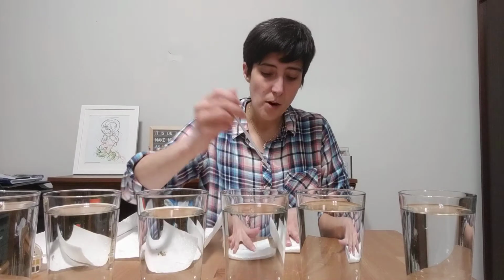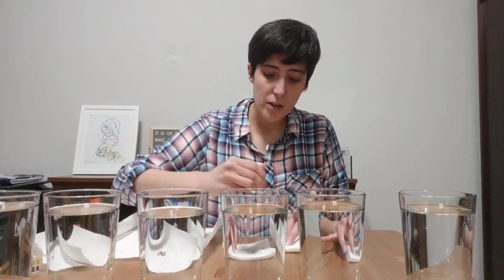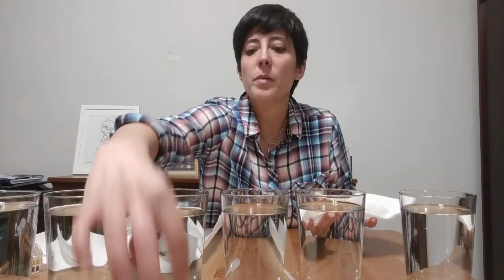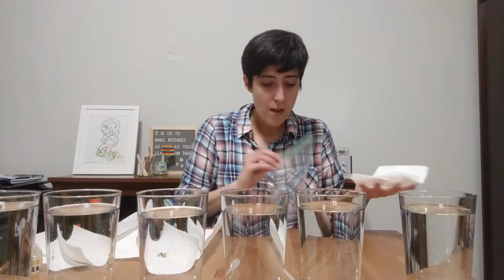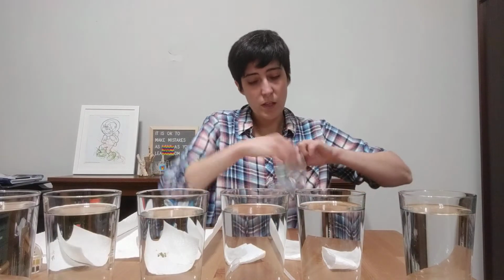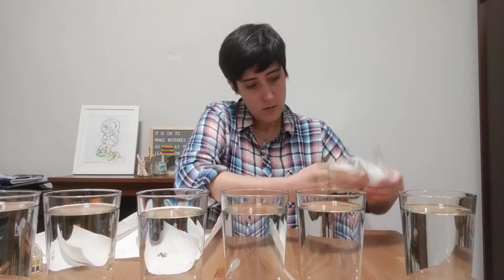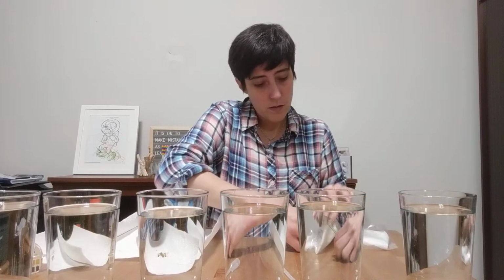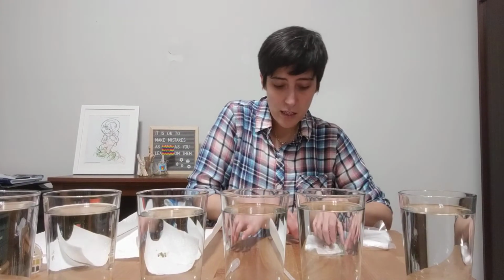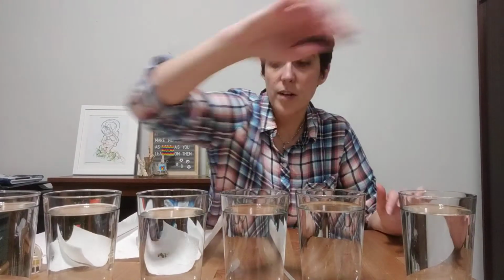Alright, so this one, remember, had 25 mLs of vinegar, so as I'm putting it on here, it is definitely smelling a little more pungent, a little more like pickles and all those other vinegar-based foods. Get that in here. Alright. Lost another mung bean, putting it back in its little packet so that we still have 10 in each. Alright, so that's our next one.